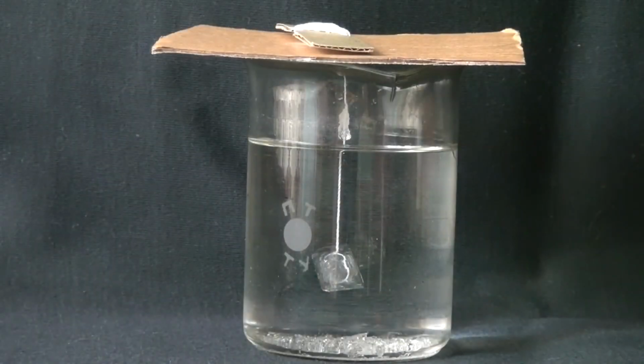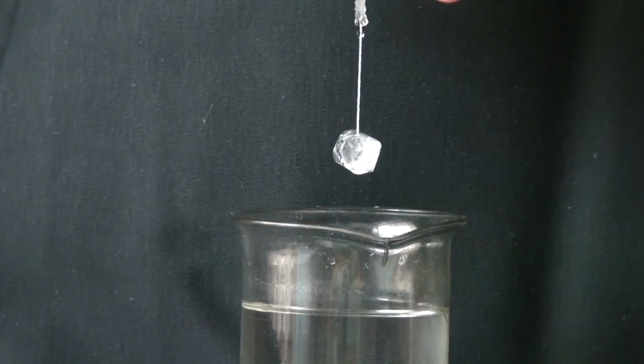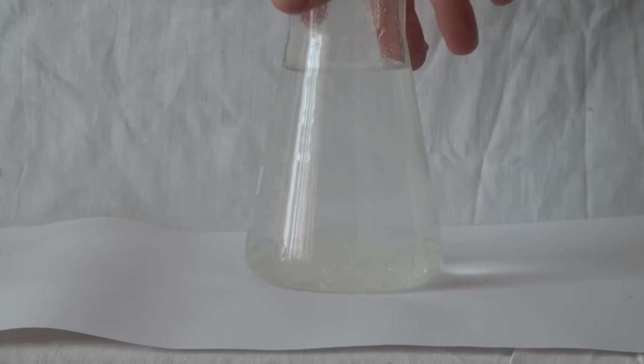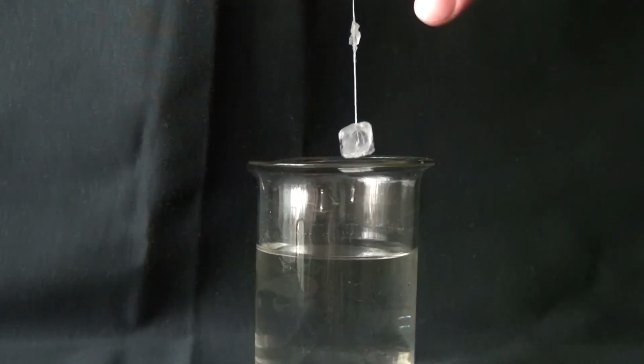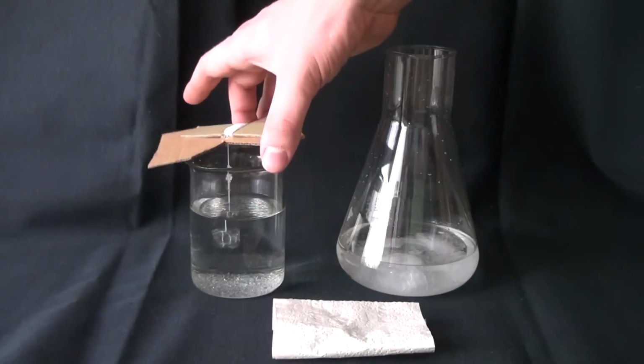Since we have a solubility curve, we can learn that the excess material that cannot be dissolved must go somewhere. And this is the substance that forms our single crystal. If we had not hung the seed, the crystals would start to form anywhere, on the bottom or on the walls of the beaker. And one more thing to mention. During the process of crystal growing, liquid from the cup will gradually evaporate and therefore the crystal grows.